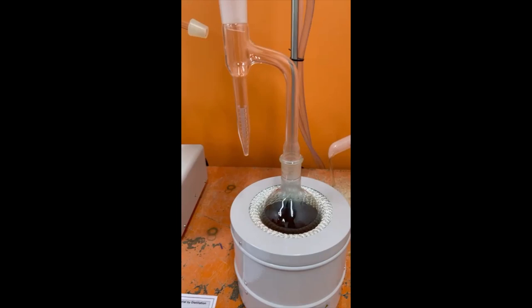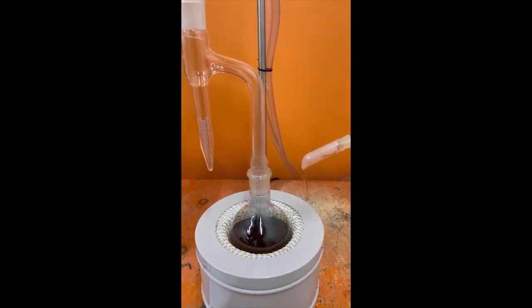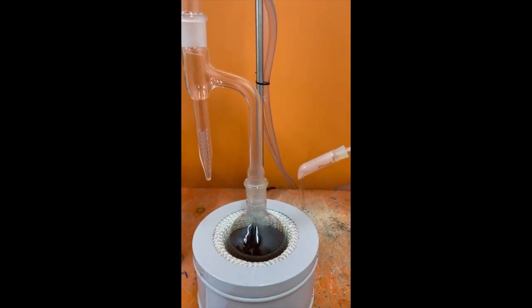Already we found water in the solvent blank. It is approximately 1.3 milliliters.